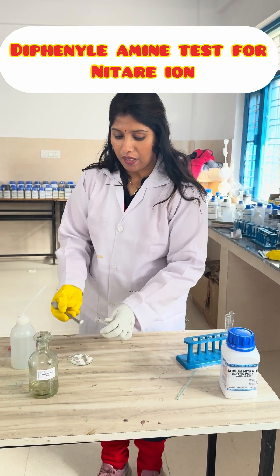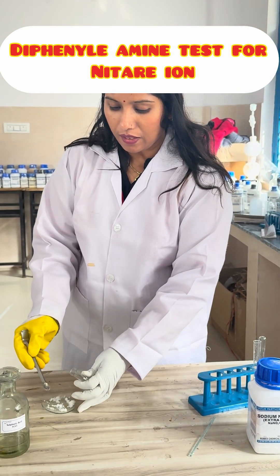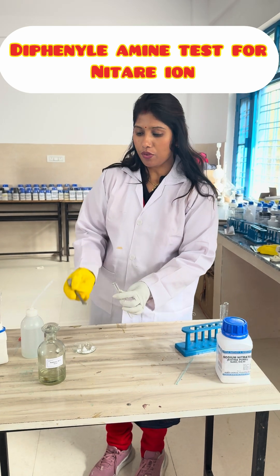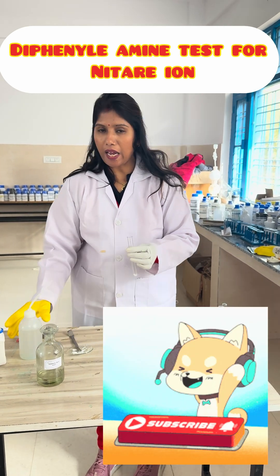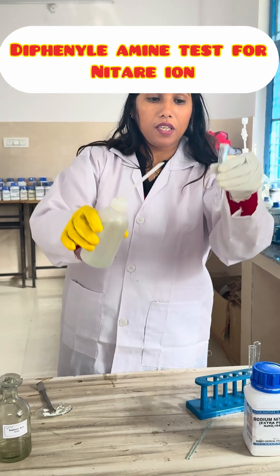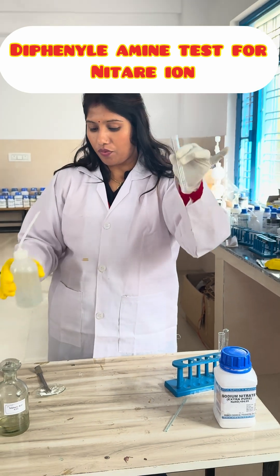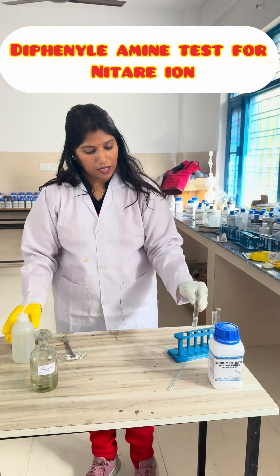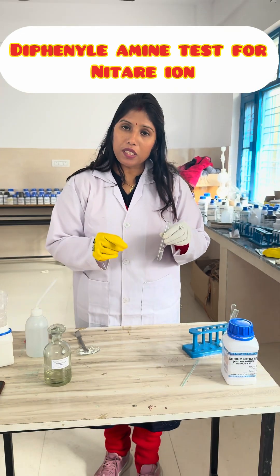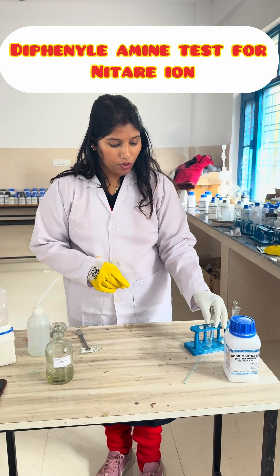First we will take a pinch of sample. Then we will make its OS. We will add water to make original solution. Now this is the OS for the sample. OS means original solution. We add water to the sample and it makes original solution.